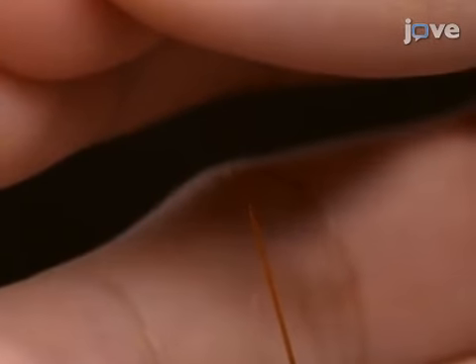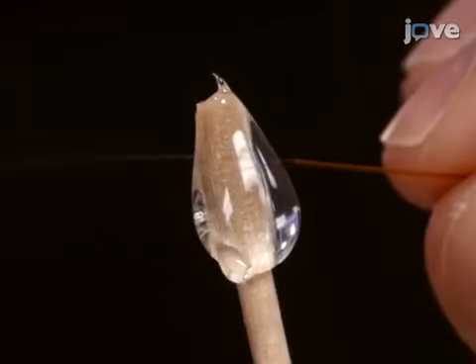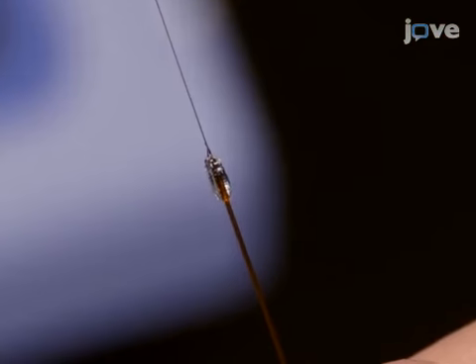Insert the smaller capillary about 6 millimeters into one end of the larger one. Then, use a Q-tip to apply a small droplet of glue around the junction of the capillaries and let the glue cure overnight at room temperature.